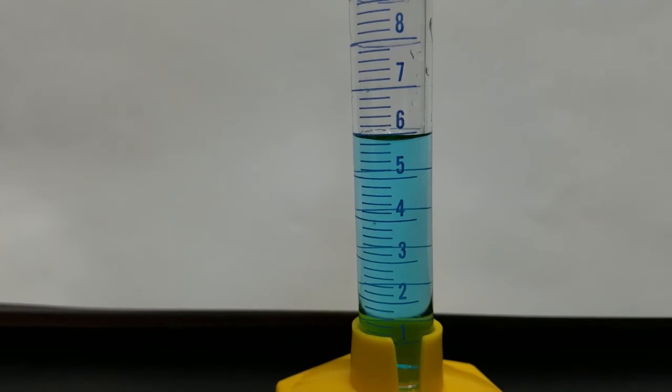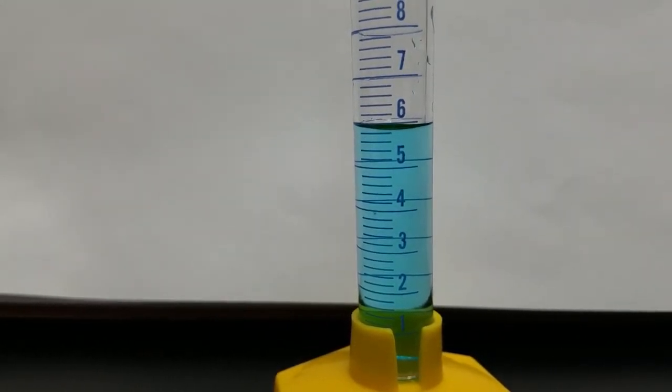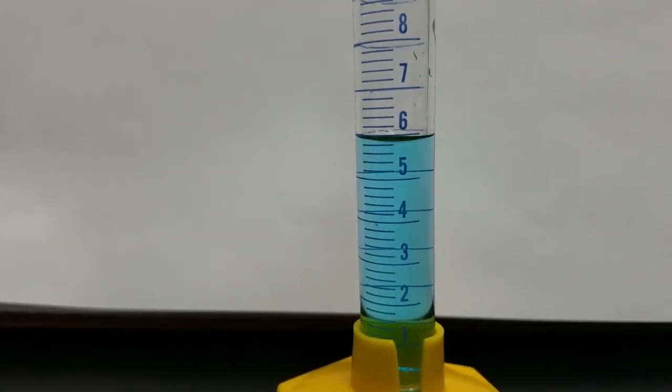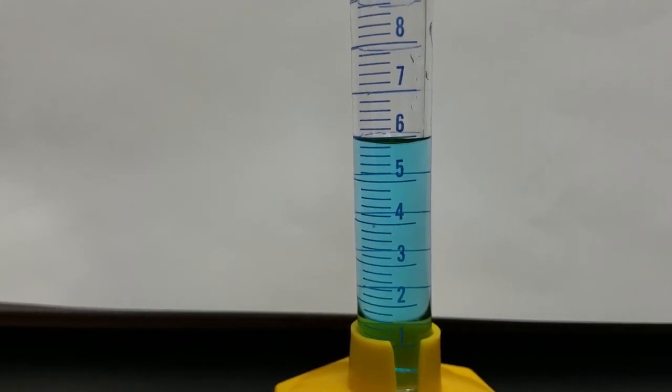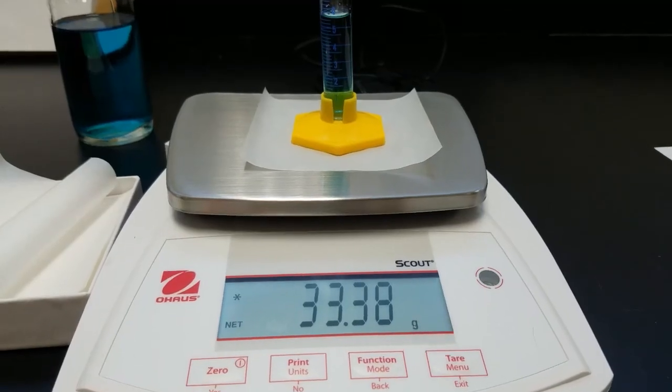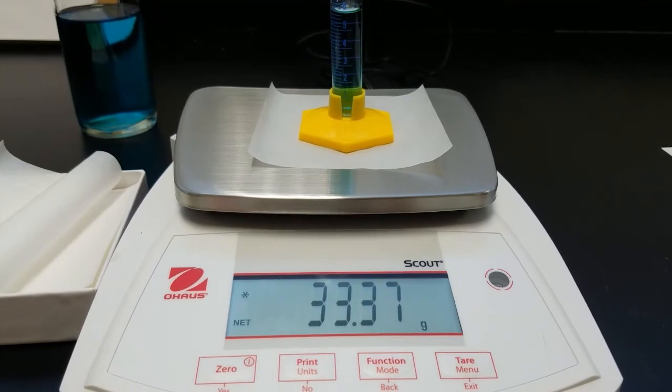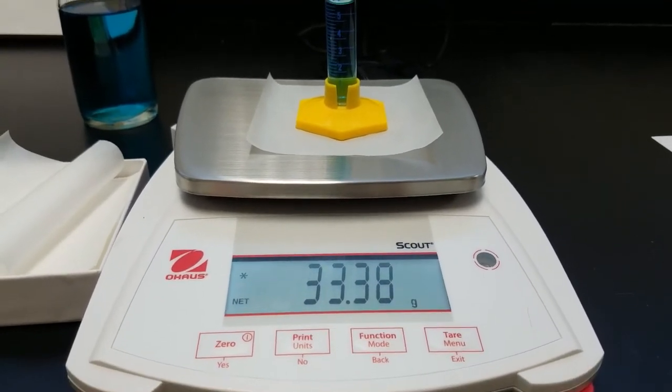An additional two milliliters of water has been added. Record the volume. The mass of approximately six milliliters of water.